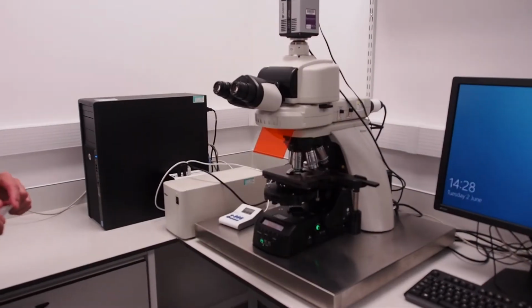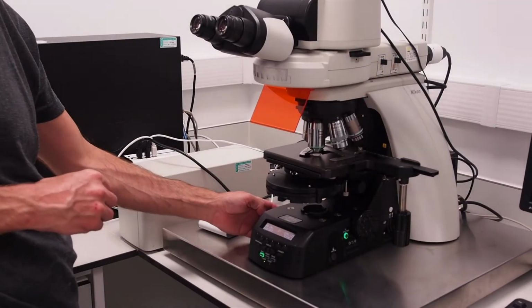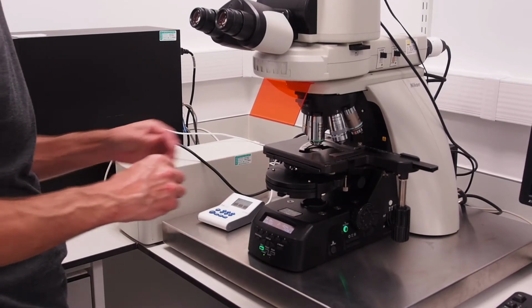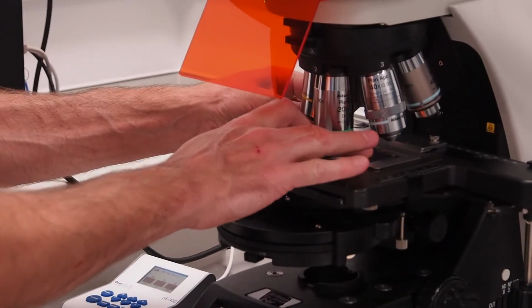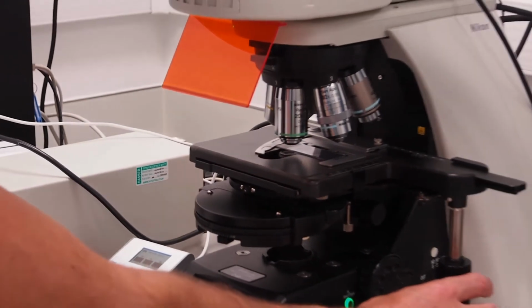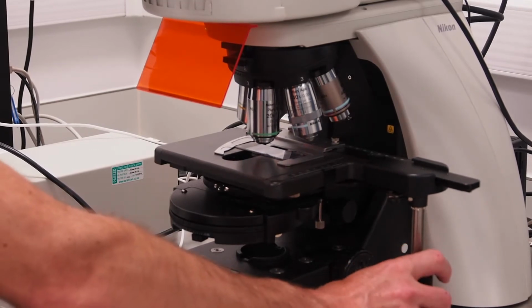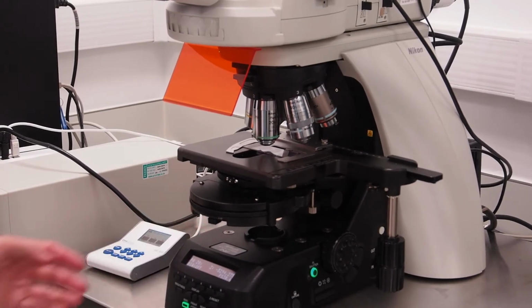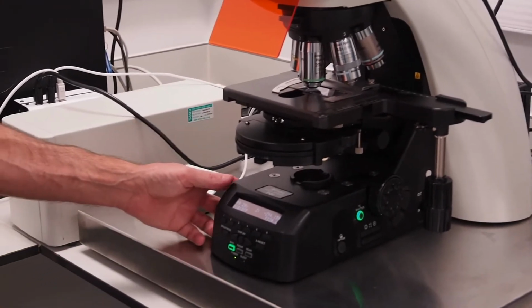To add a sample to the stage and use an air objective, first press the button labelled Escape on the lower left-hand side of the microscope body to lower the stage. Now add your slide to the stage, ensuring it is cover slip upwards and held in place with a spring clip on the left. Using the manual stage control stick, move your sample until the area of the cover slip containing your sample is beneath the objective. Press the Escape button once more to move the stage back to the original position.